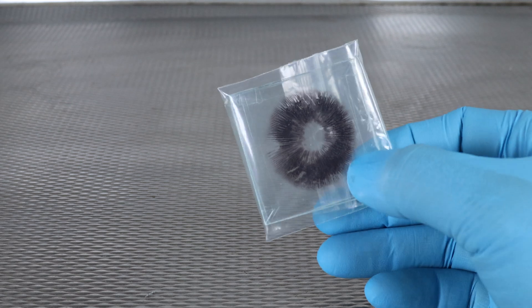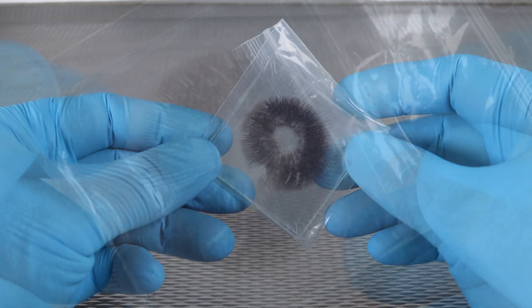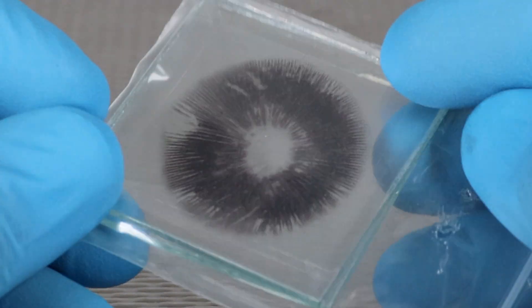We're also going to need a spore print. I have a lovely print here from a favorite medicinal species that I'll be using during today's procedure. Look at that, you can really see the gill structure in the pattern of the spore print through the glass.